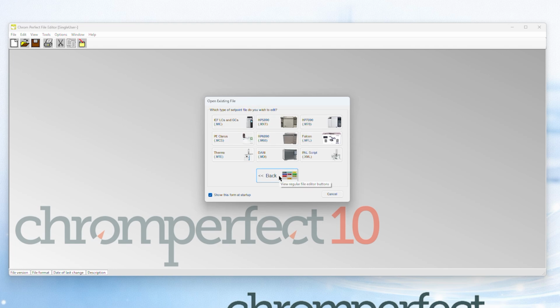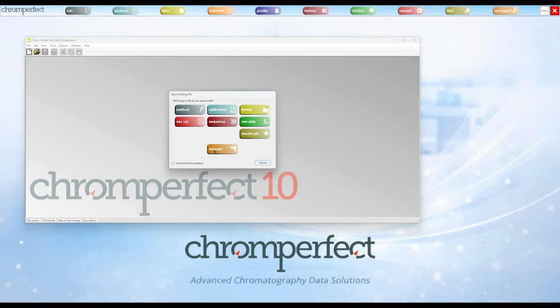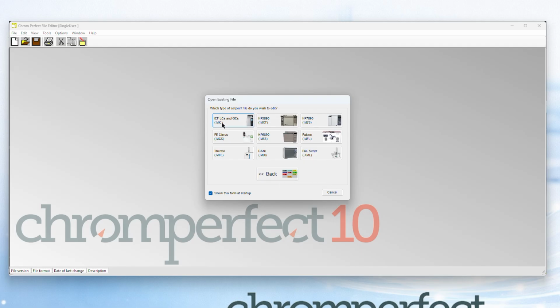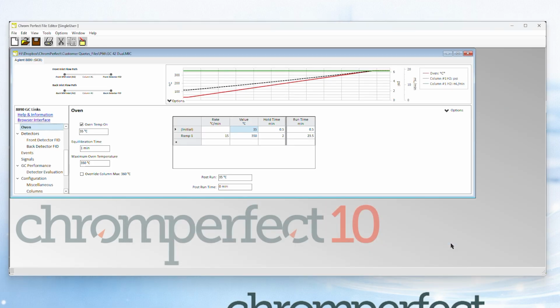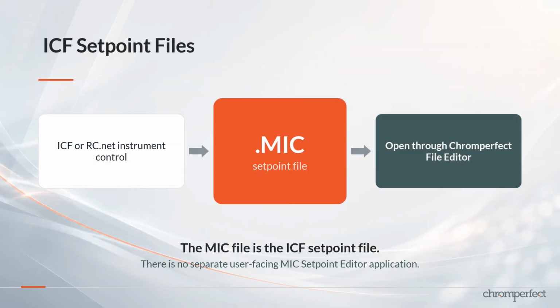So, if someone tells you to open the MIC Editor, the M78 Editor, the 7890 Setpoint File Editor, or simply the Instrument Setpoint File Editor, the practical instruction is normally the same. Open Chromperfect File Editor, choose File, Open, select the appropriate setpoint file type, and then open the relevant file. For ICF or RC.NET instrument control, the setpoint file normally uses the MIC extension. The MIC file is the ICF instrument setpoint file, and opening that file through Chromperfect File Editor launches the corresponding MIC Editor form. The user should not go looking for a separate visible program called the MIC Setpoint File Editor.